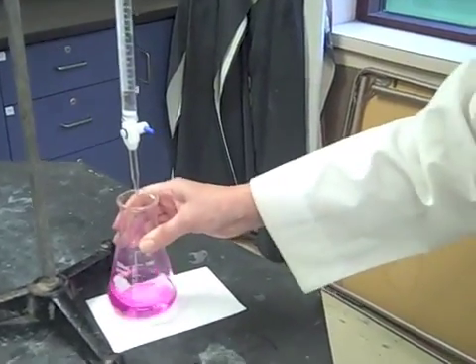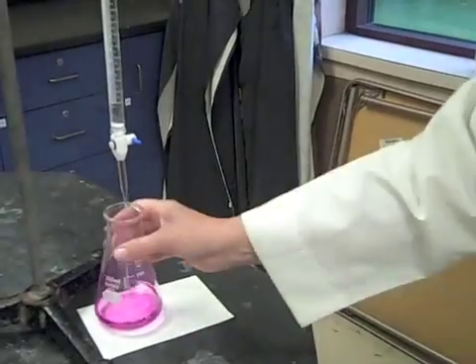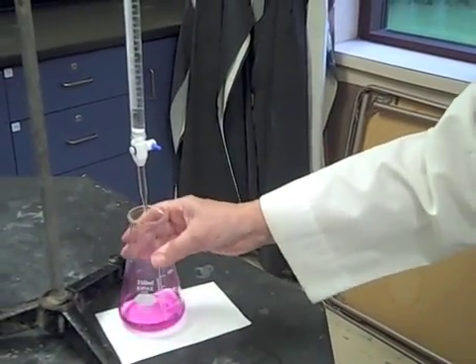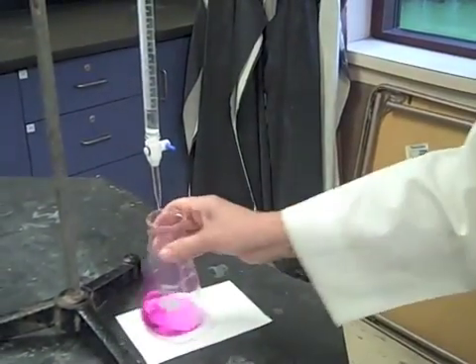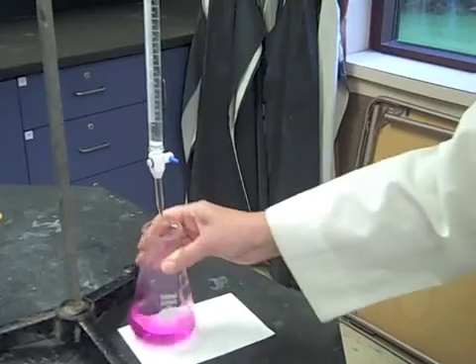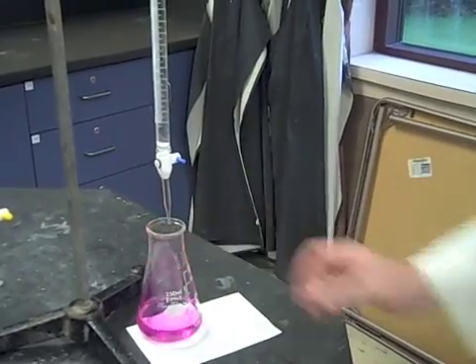Now, the rule is you need to, and it doesn't matter that I've added water at that end. Remember, that doesn't affect your results. But I'm going to swirl this to make sure that I got everything I could.